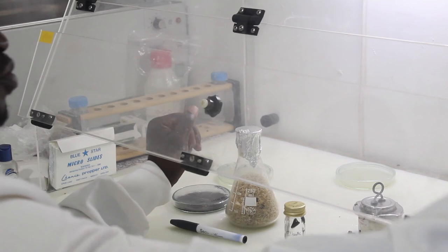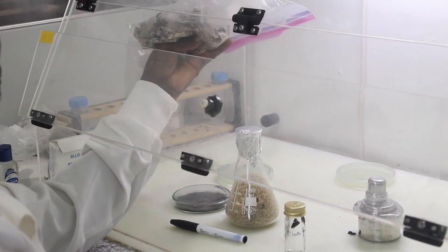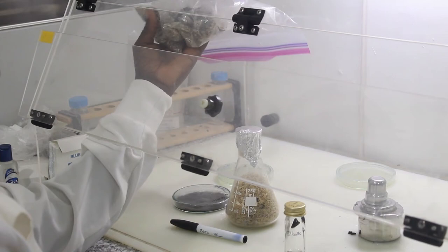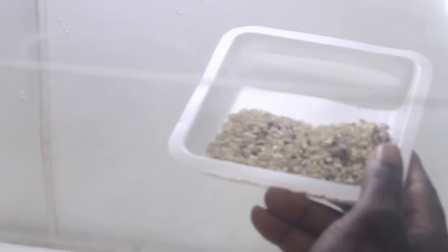And this will be the result. We will use this to inoculate the cowpea genotypes that will be screened for resistance to Macrophomina phaseolina.